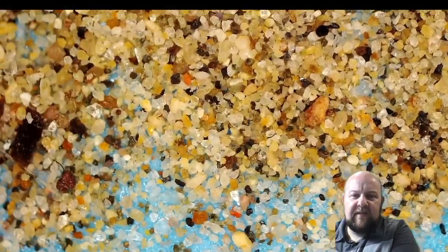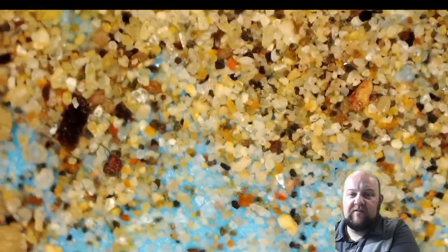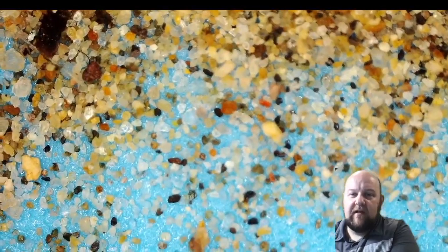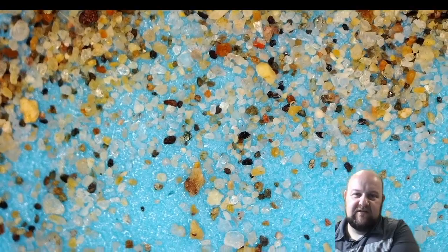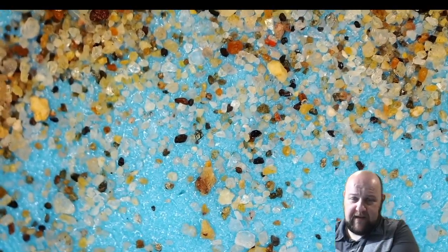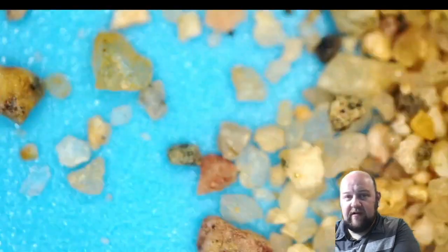But sand is made up of just rocks, shells, whatever it is, but with a constant flow of water, it breaks it down into smaller and smaller and smaller pieces over thousands of years. It's amazing. You can speed that process up by having like a tumbler. If you've seen rock tumblers that will smooth out rocks, well, these aren't necessarily smooth, it's just broken up. Kind of amazing.